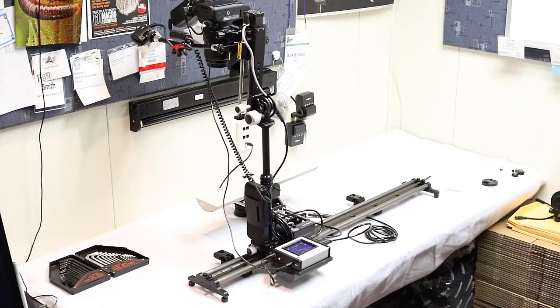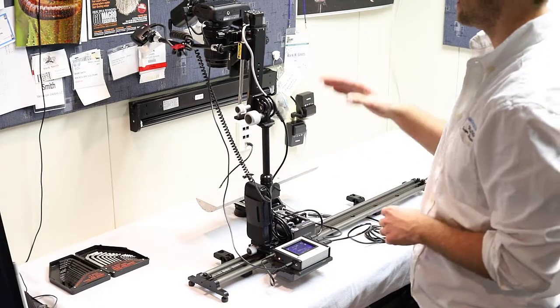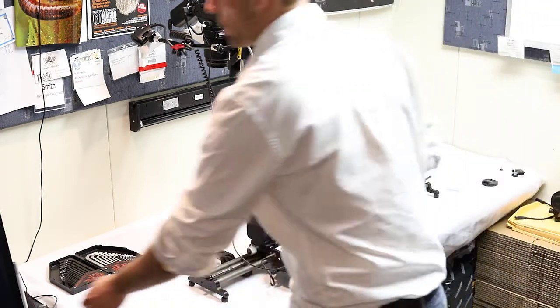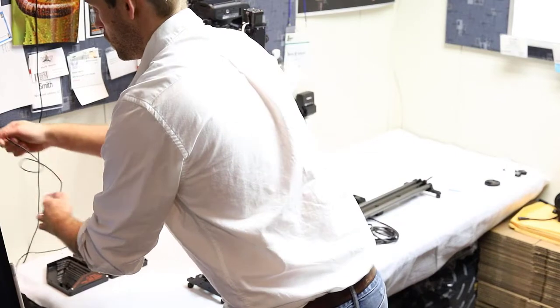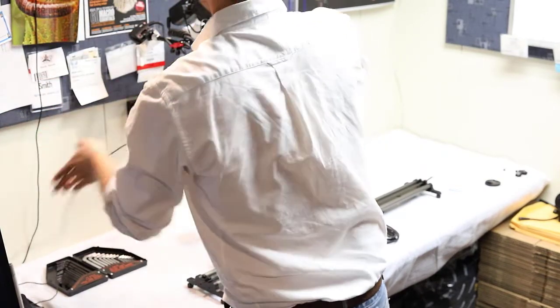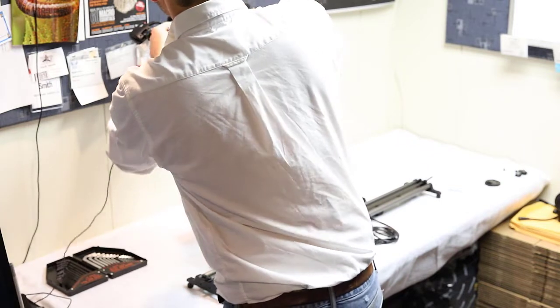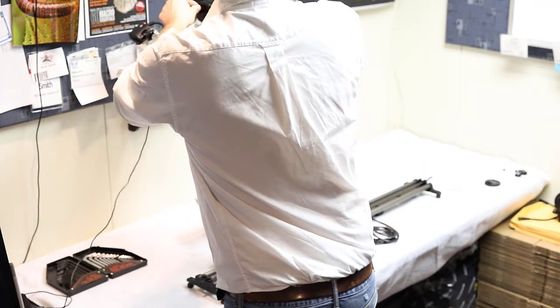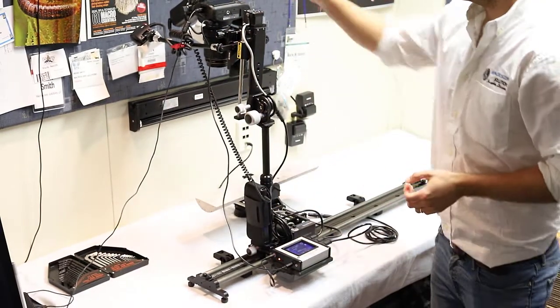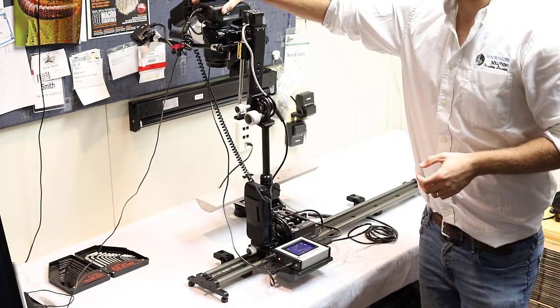Okay, so now we're going to turn our attention to the MacroCore system. And since we want to have all of our images centralized on the computer, we just connect our computer to the camera using the USB cable that you have. In this case, it's just a micro USB port that connects directly to a USB or USB-C on your computer. So that's on, and now our first step is to turn on the camera.